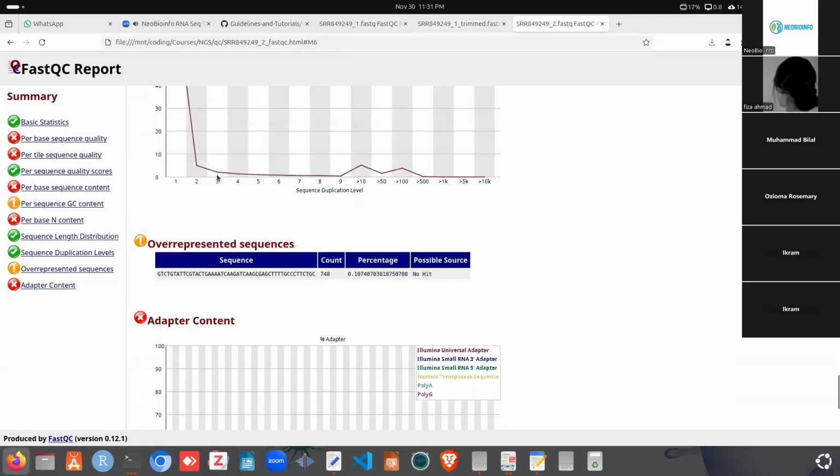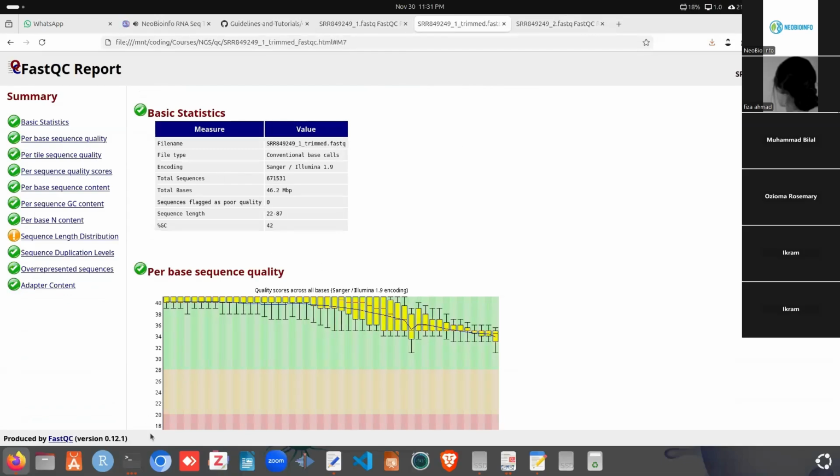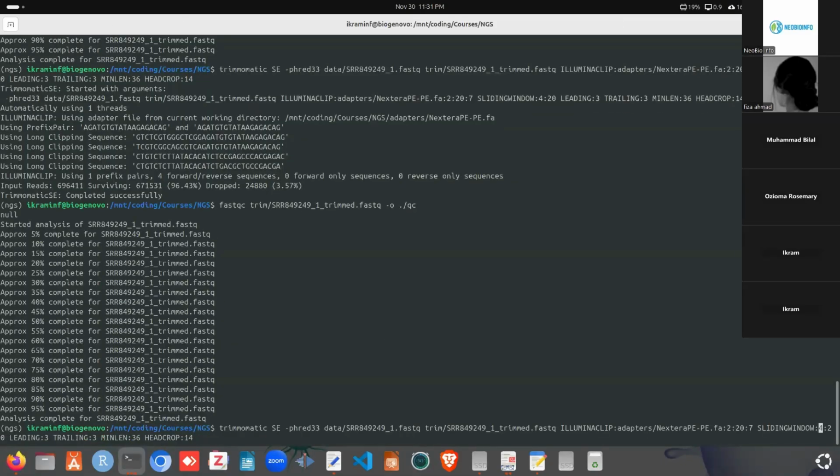For this one, we can run the same command. As it is a paired-end file, we can proceed with the paired-end command. For the paired-end command, we can specify it here. We used SE here, so we need to specify PE here, and we already have the phred33. For paired-end, we have two input files.